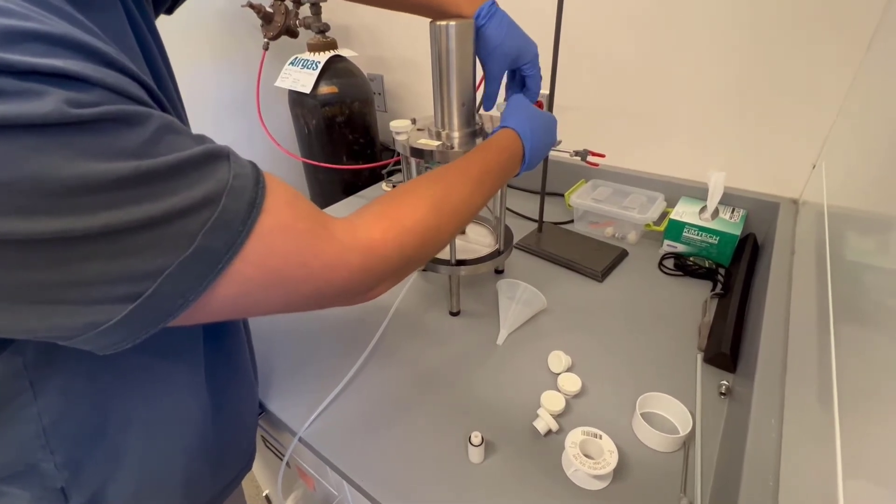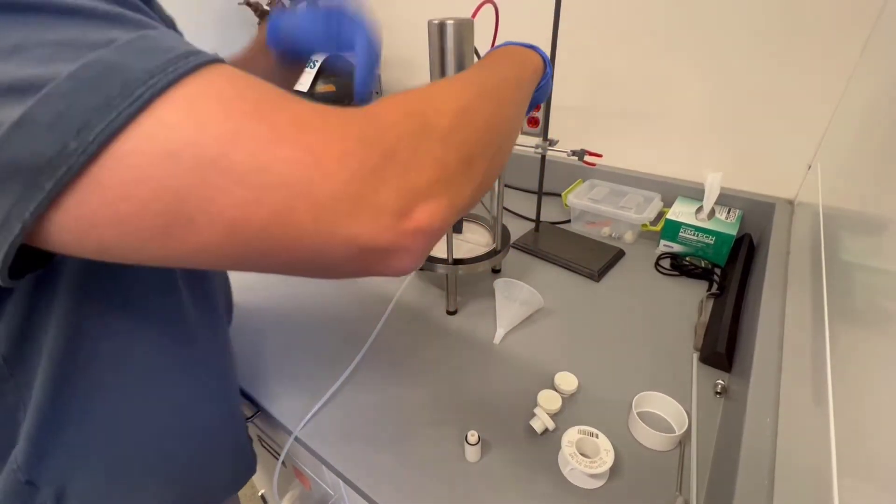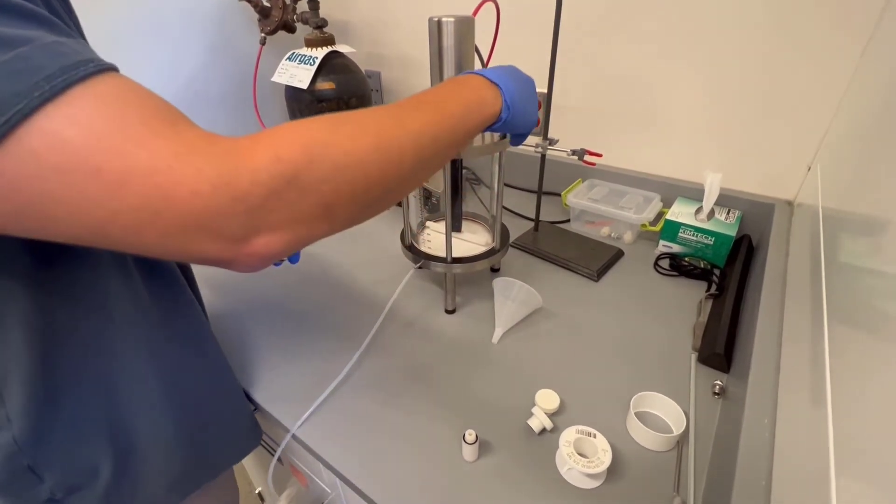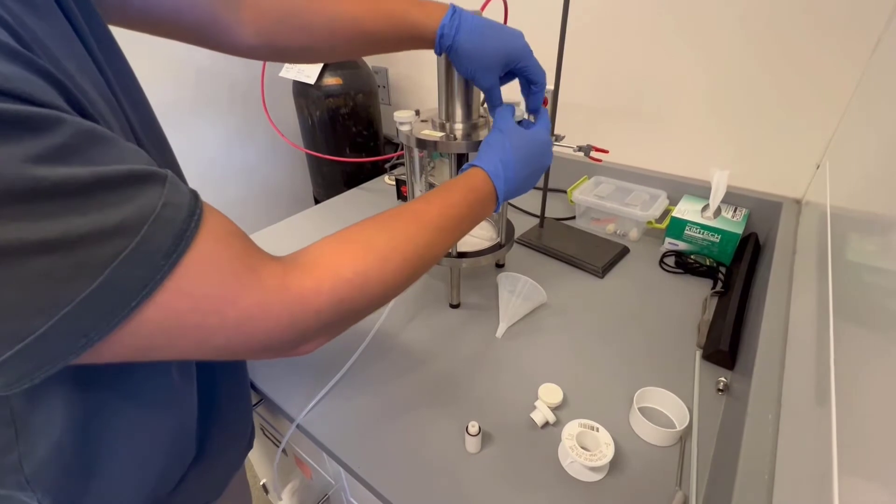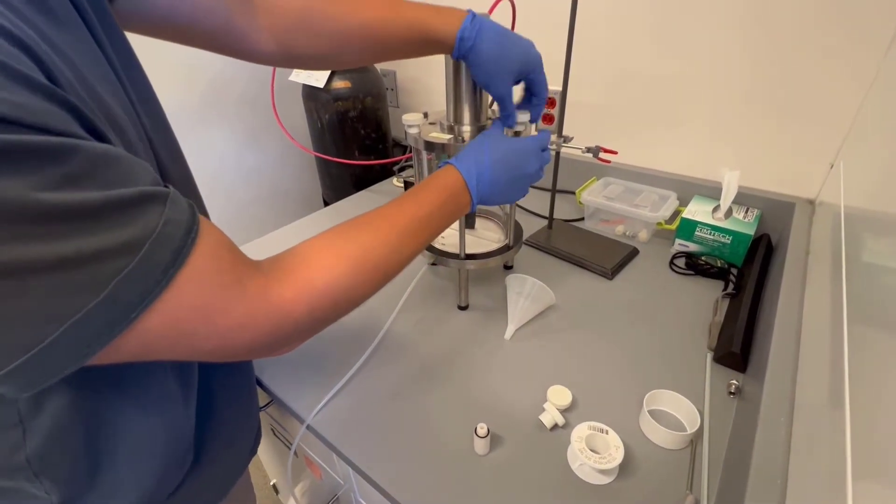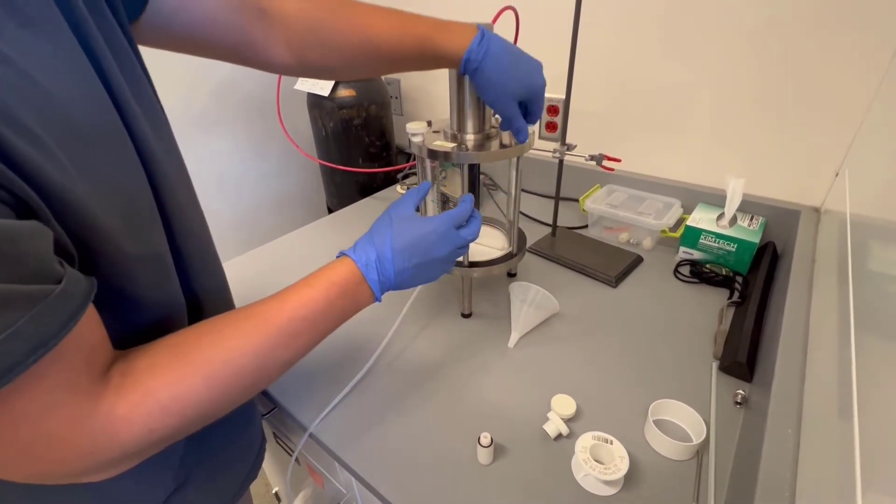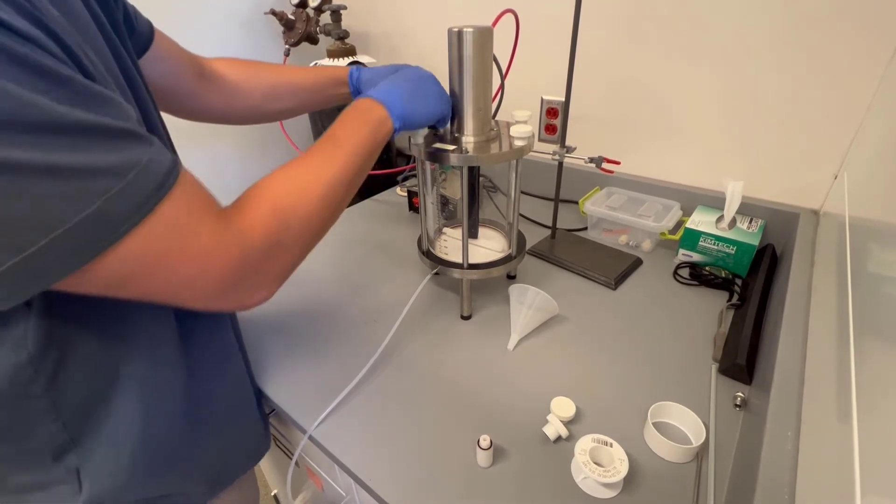So this will probably take a second. And for those unfamiliar with what I mean by the star method, it's just going across to the other one when you're fastening it in, so then you're applying force on each side evenly.